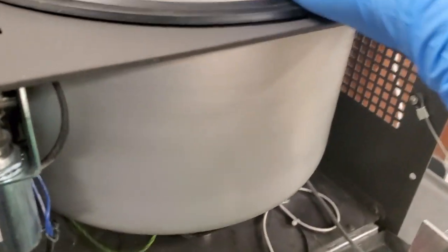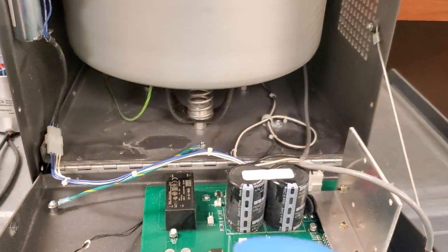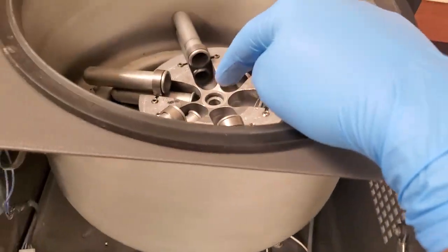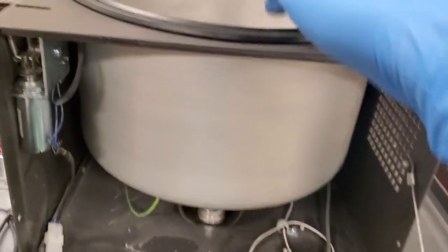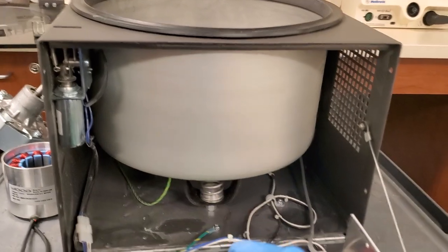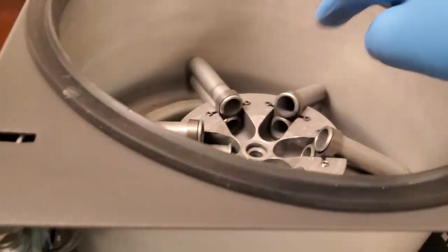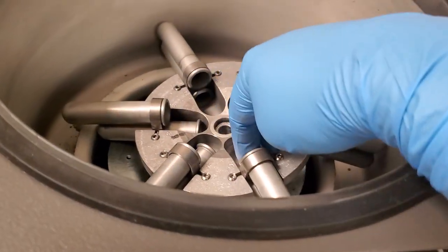So what happened? Well, here's the interesting thing about this type of centrifuge. This centrifuge does not have a wobble detect or out of balance sensor. So what it does is it relies on the RPM of the rotor at a certain time or a certain amount of pulses. It pulses to the motor, it expects a certain RPM that will tell you if you got the correct rotor in, and it also tells you if there's any other problems. Well, if it's out of balance, you can see right here a ring of abrasion. So something's been going on. But this is also an all-metal rotor. You can see there's a lot of moving parts in there.